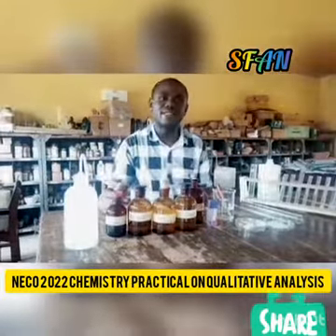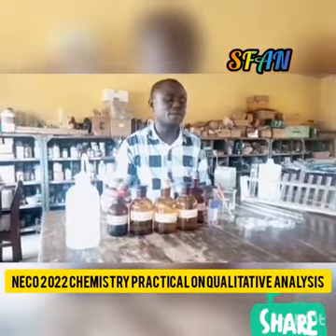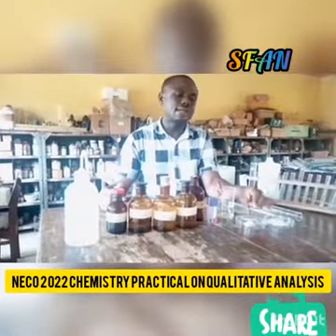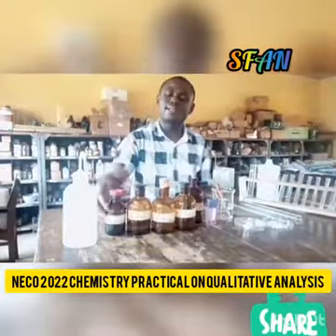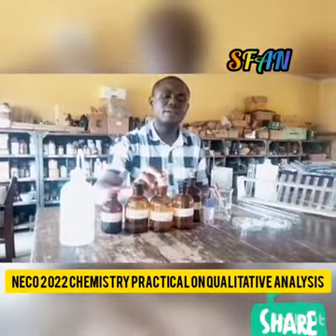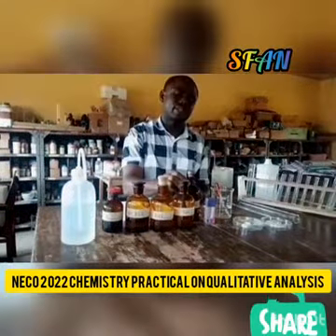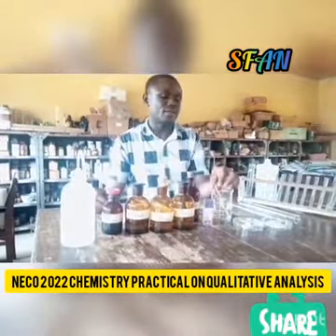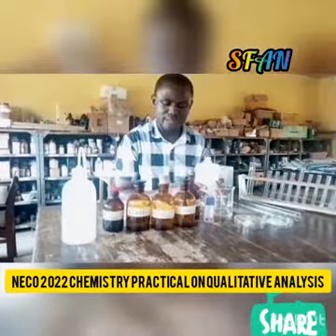to be doing the qualitative analysis for the NECO 2022 examination. We are going to be analyzing zinc carbonate that is labeled X and aluminum chloride that is labeled Y. For this analysis, we will require silver trioxonitrate(V), dilute HCl, aqueous ammonia, sodium hydroxide, and trioxonitrate(V) acid. We're also going to require litmus papers, droppers, sets of test tubes, and then lime water.